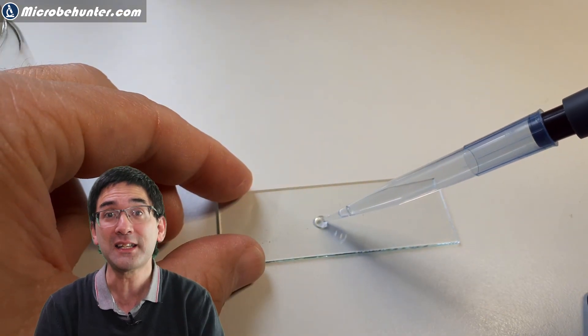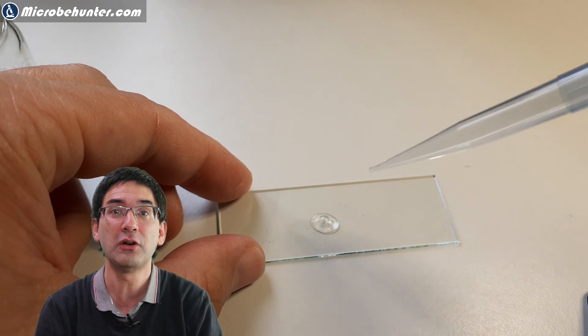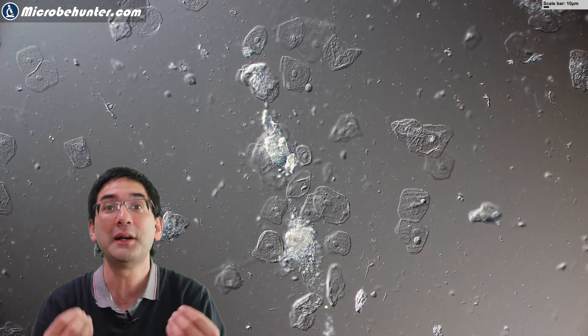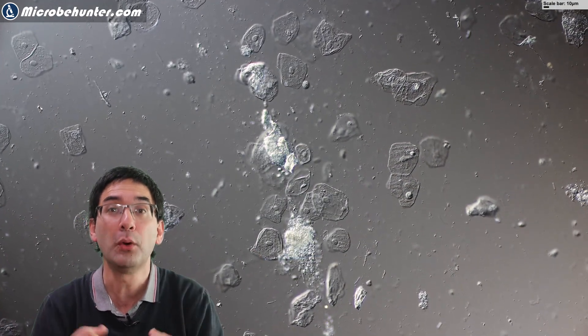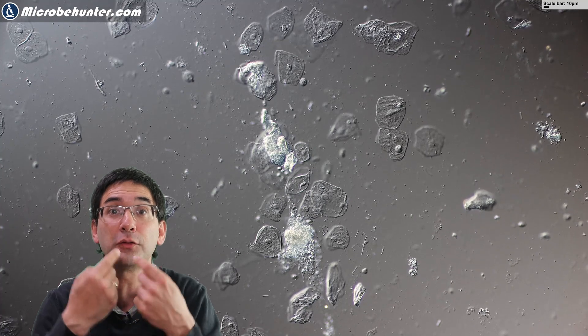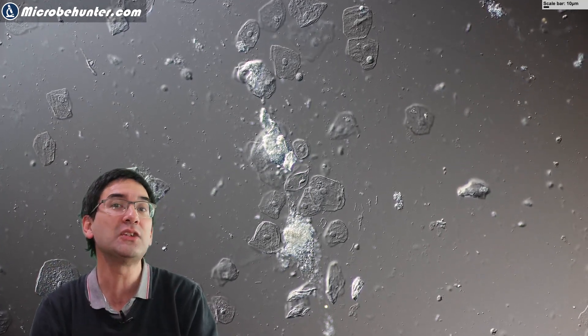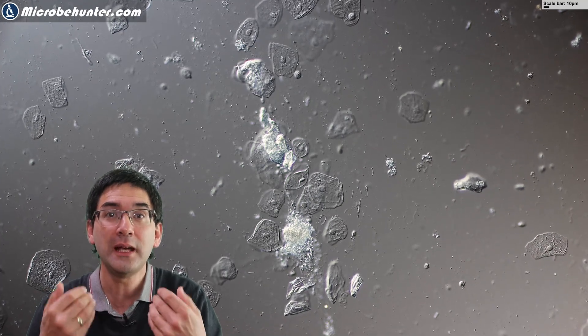And as expected, of course, there are lots of particles, debris, very much unidentifiable material, but also quite interesting, quite a few body cells from my lungs and from my respiratory system, which I also coughed up. So those flat cells that you see there — these are actually epithelial cells. You might have already seen them before in one of my other videos where I took some cells from the inside of my cheek and put it under the microscope.